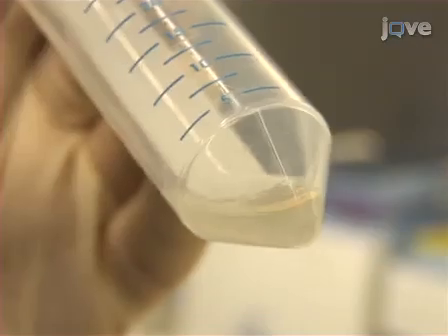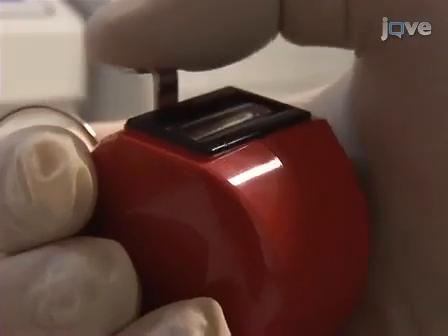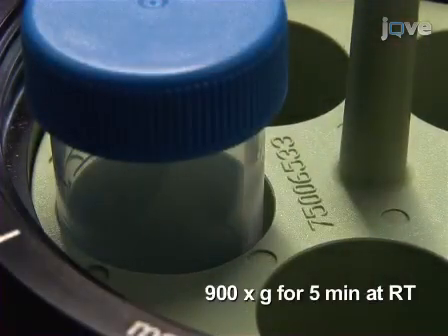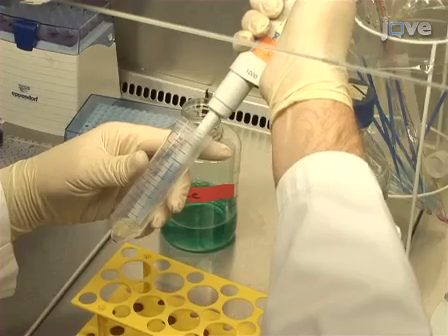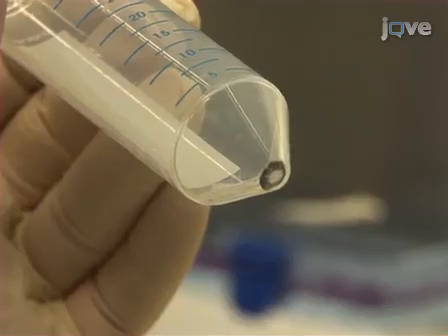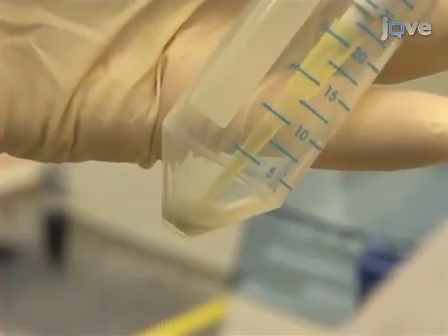Resuspend the spore pellet in 2 milliliters of PBS and determine the total number of swollen conidia by cell counter. Spin down the spore suspension again under the same centrifuge conditions as before, and afterward carefully remove the supernatant. Resuspend the sedimented conidia in a final concentration of 1 × 10⁷ cells per 100 microliters of PBS.